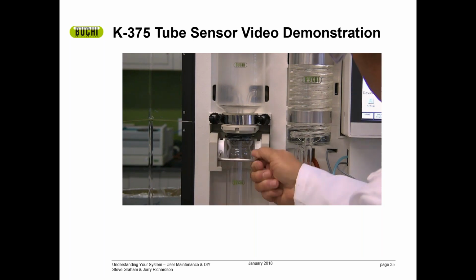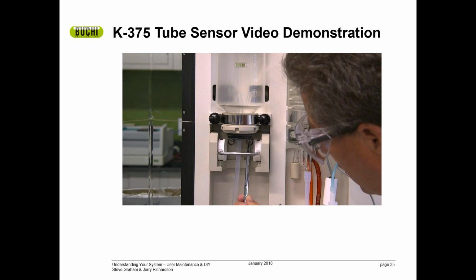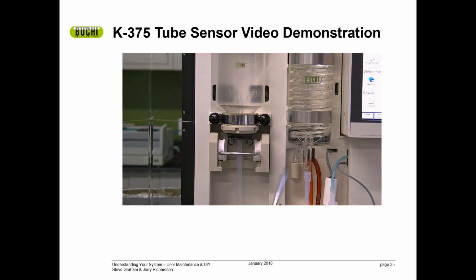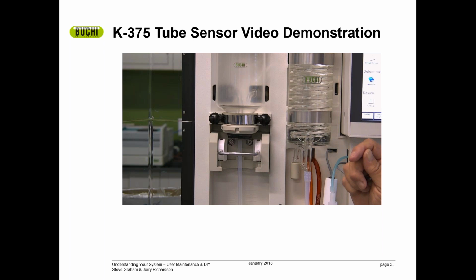If we take a look, if you have a sample tube on your system and you get a no sample present or no sample tube present error, what you need to do is loosen these two screws and run this up just a little bit so that it is tighter to the system. What that does is change the sensor location so that it sees the sample tube on the system.